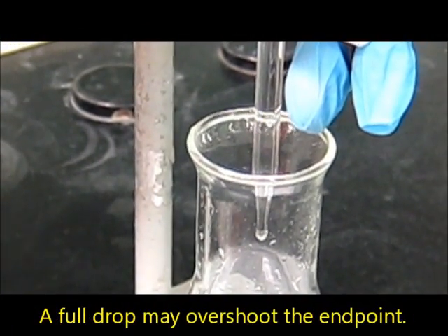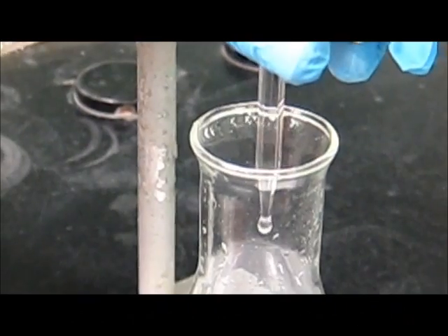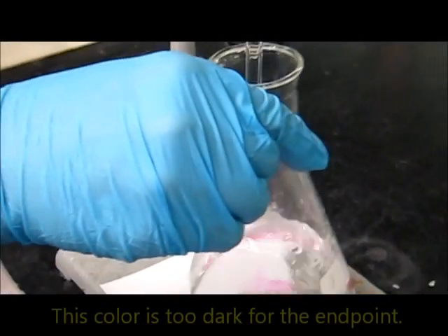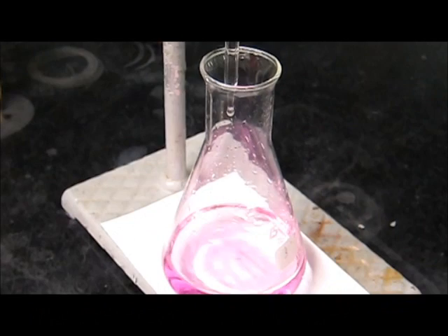Make no mistake. Just a single full drop may overshoot the endpoint. This colour is too dark for the endpoint. Really, too much.